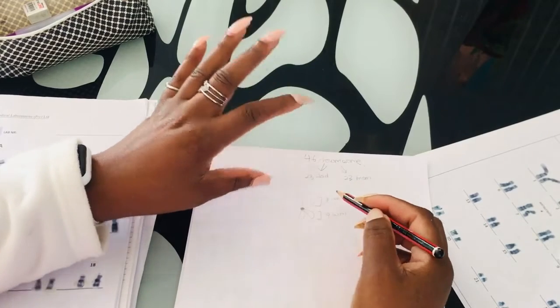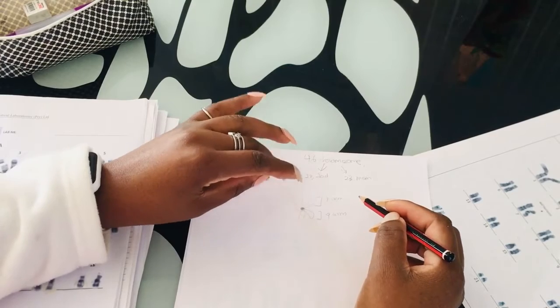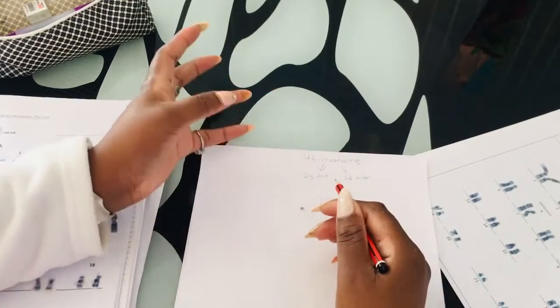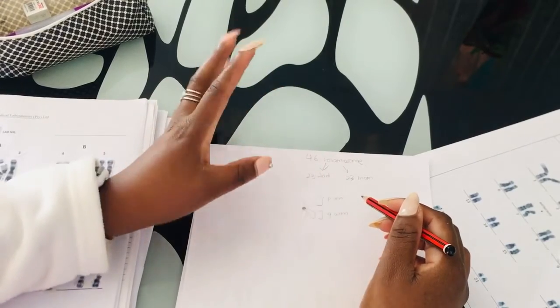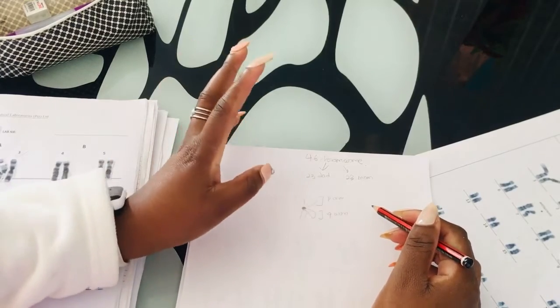The most important thing when you look at a chromosome, before you even figure out where it belongs, is to have an idea where your centromere is located. Where is the central part, the middle part, the joining spot, the spot that joins the P arm and the Q arm, the two arms that each and every chromosome has?